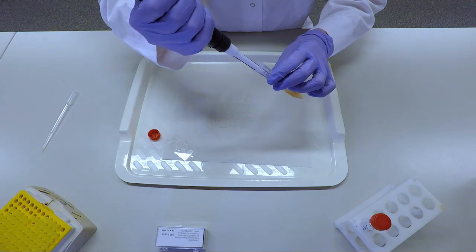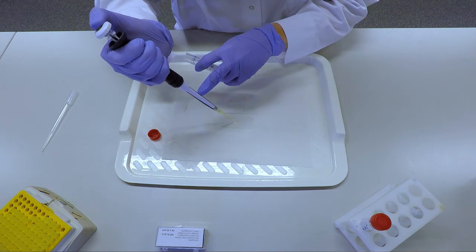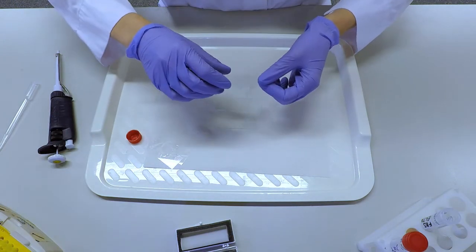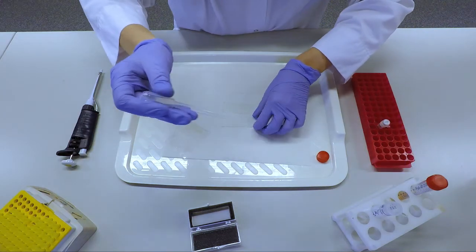Put one or two drops of serum for 30 seconds to one minute covered with a coverslip. This step deactivates the trypsin.